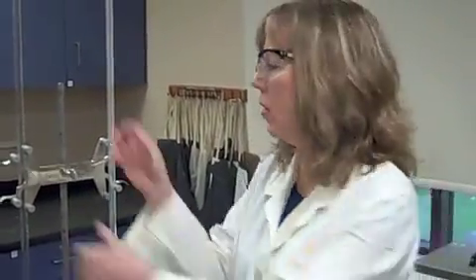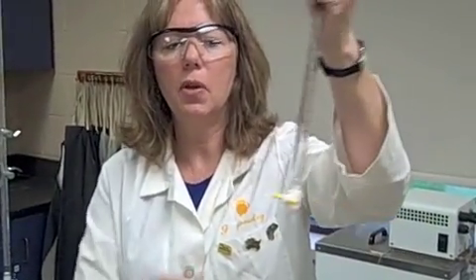The first thing I want to show you is proper lab technique. Yes, this is a race, but you also want to rinse out your burettes. They're supposed to furnish clean burettes for you, but you still want to rinse them with the solution you're going to be using.